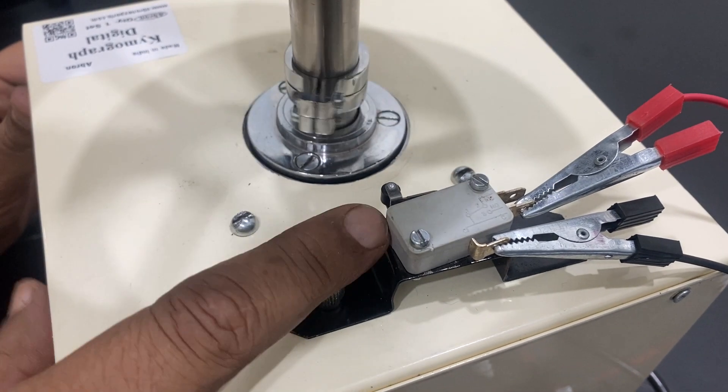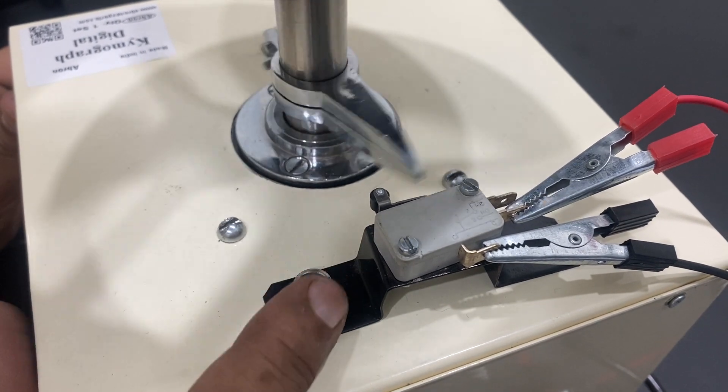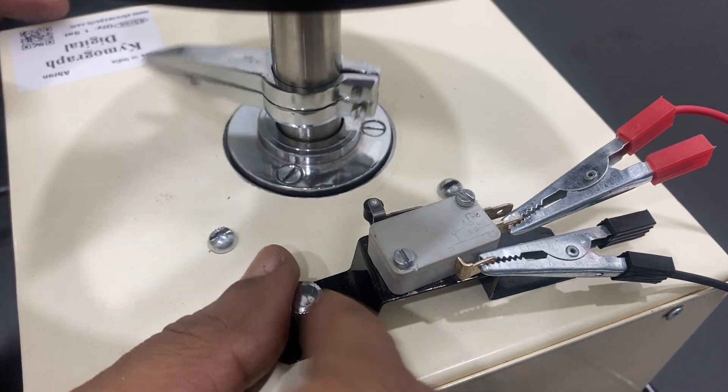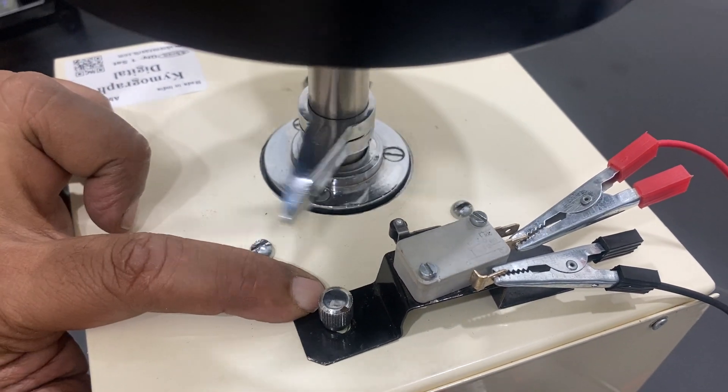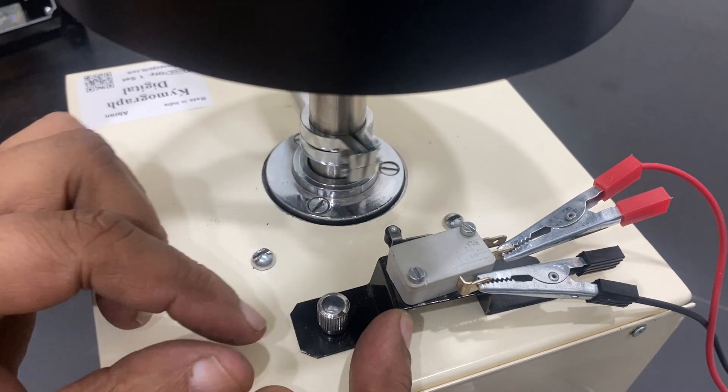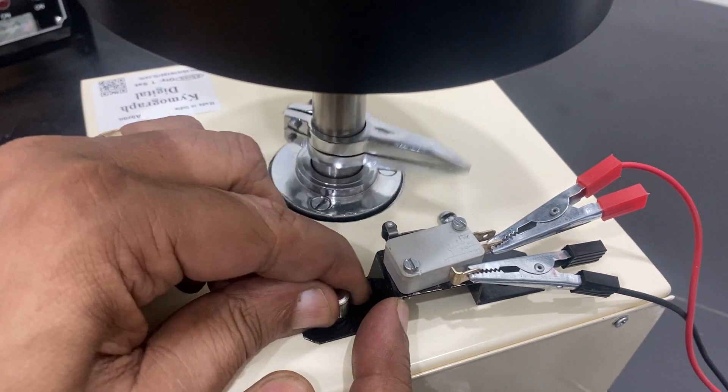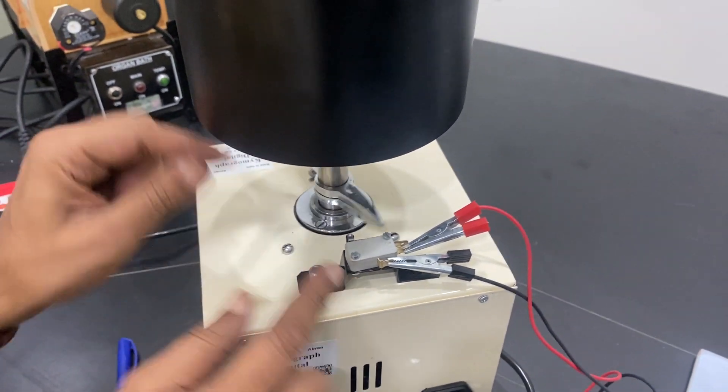It will give you a pulse. See, this one pulse. If you do not want it, open it, put it back, no problem. It will not give you the pulse. You have to adjust it and then tighten it. See, another adjustment, there are two points of this.